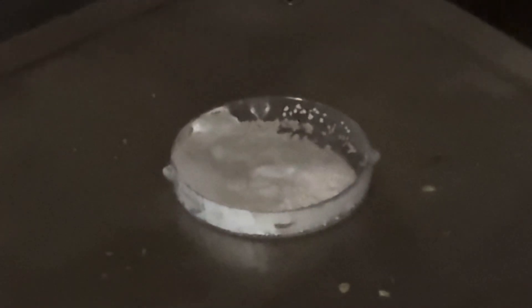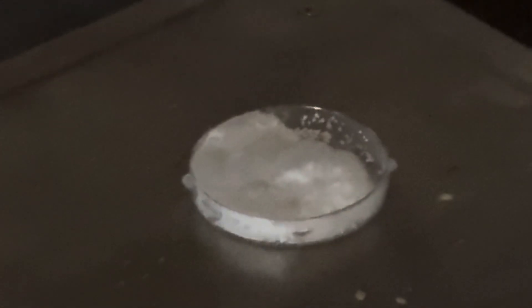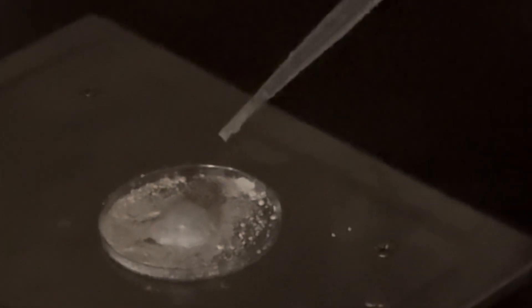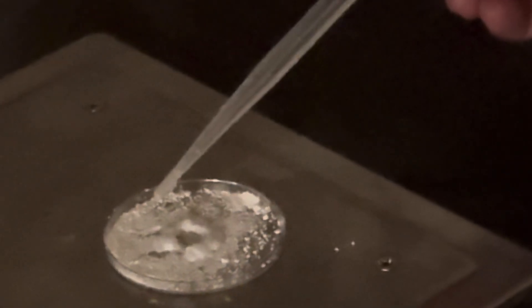You see a little bit of red. Yeah, but a lot more of the liquid. Okay. That's what it is. I think it's a concentration. Is it red? Yeah, it's slightly red. You can see it turn slightly red, but I think it needs to be really dark. I think when you just do a tiny bit, you can see the red.